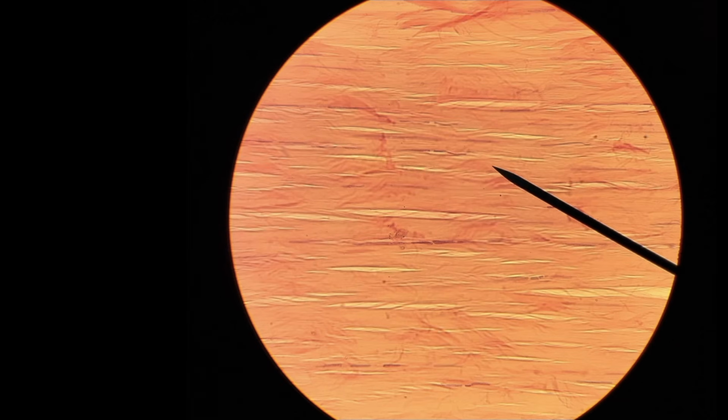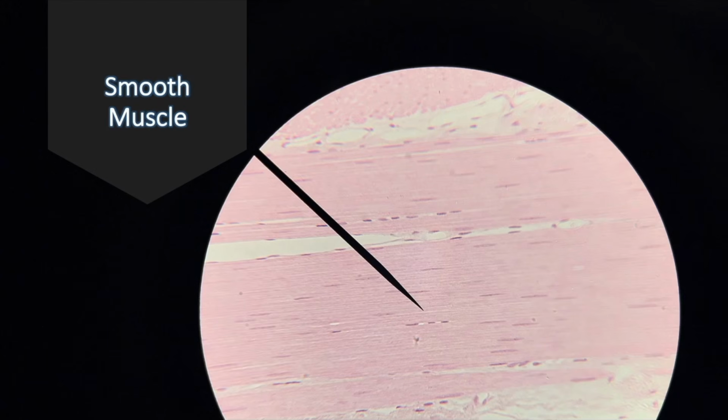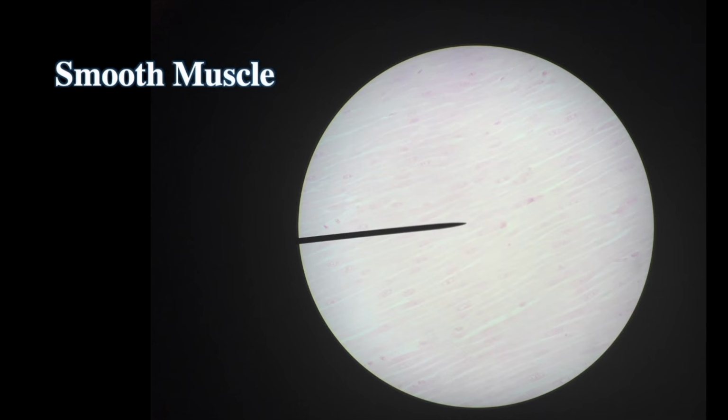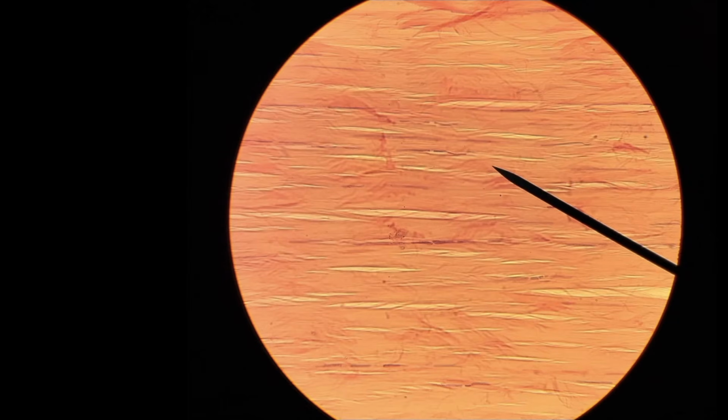All right. This kind of looks like smooth muscle, doesn't it? But there's a lot less white. These pink bands are a lot wider than with smooth muscle. Let's take a look at smooth muscle again. Oh yeah, these are much thinner. Whereas with these, they're much wider. This is collagen inside. The broad pink bands are all collagen.